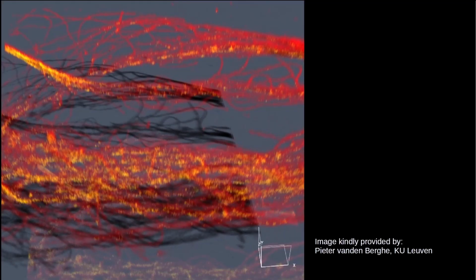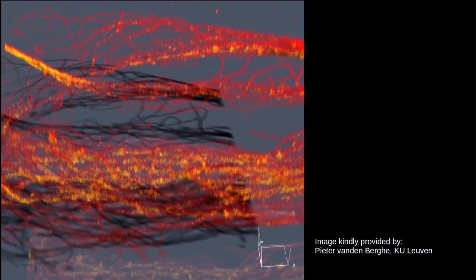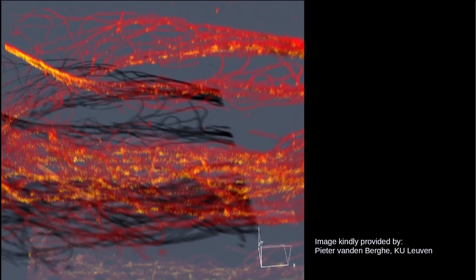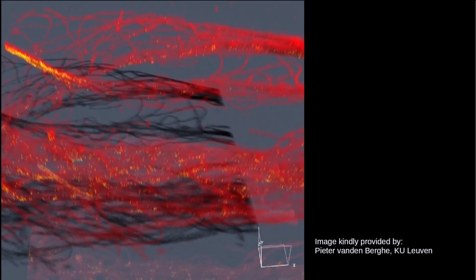Now, what we see here is not a time series of a moving fibroblast cell. Rather, it is a single array detector image with the information over all 32 detectors displayed one after another. Here we visually see the differences in intensity of the central detector with respect to the outer detectors. Note that a shift in the data is also visible. Take a quick moment to look at the shadows projected onto the background to really see this effect.